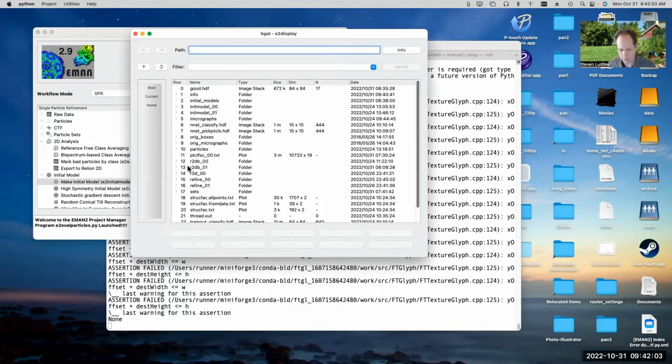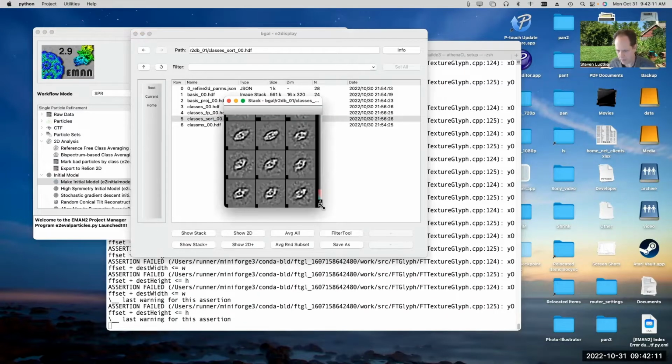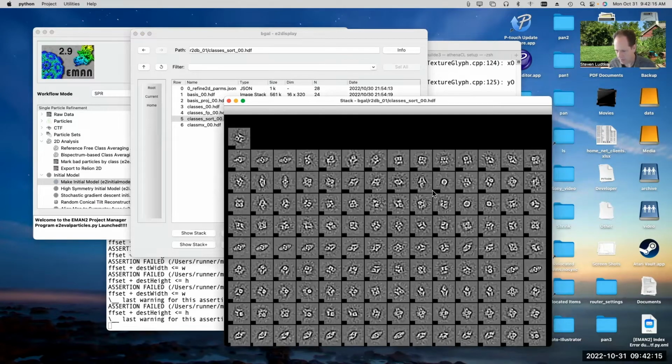So if we want to run this approach, first thing we need to do is go into our particle generation. I'll go ahead and use the downsampled class averages for this because it'll help the program run faster when it runs. Then I open up my set of class averages and I look at them, and I want to pick a few representative particles from all of the different views that are present here.